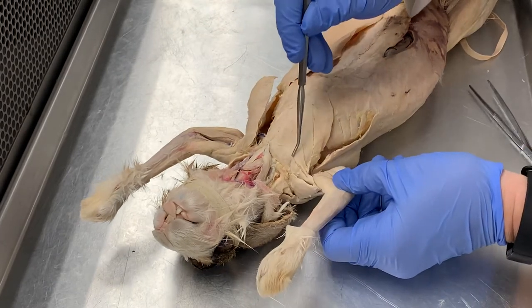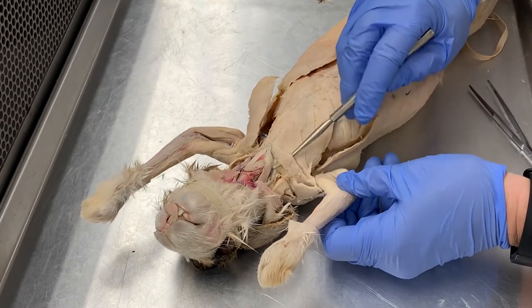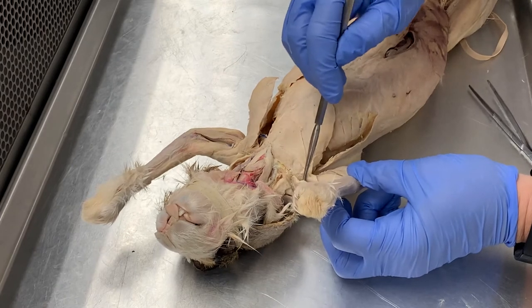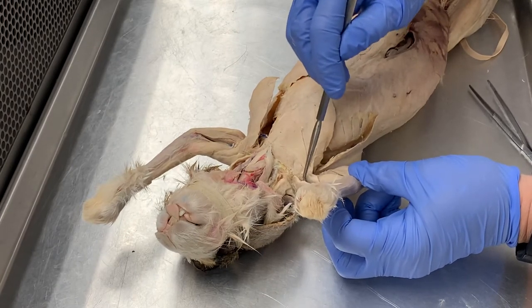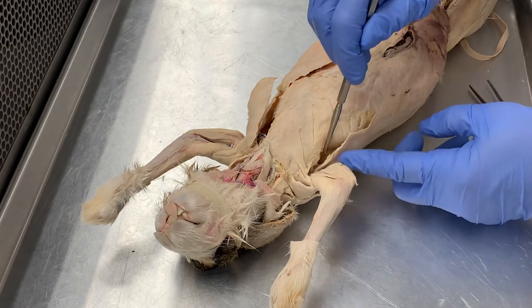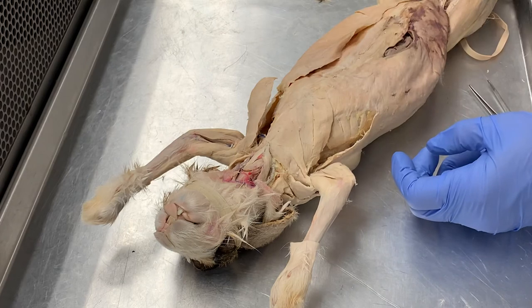Then we see the pectoralis tenuous right here, and then you can also see the clavodeltoid, also sometimes known as the clavobrachialis, and the latissimus dorsi which is overlapping some of the deep chest muscles.